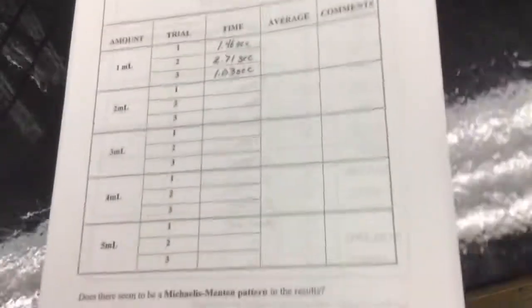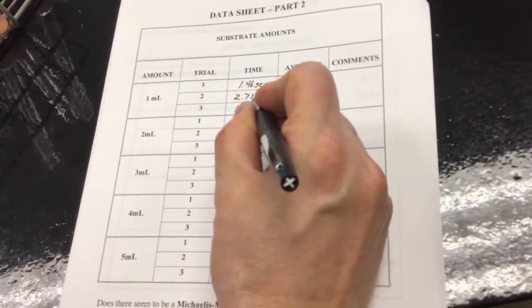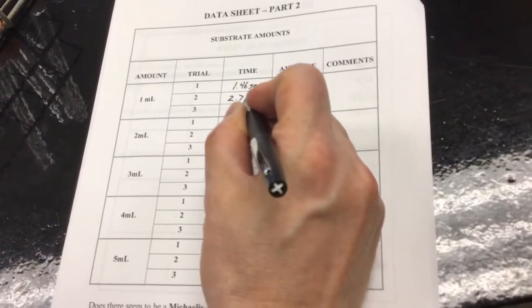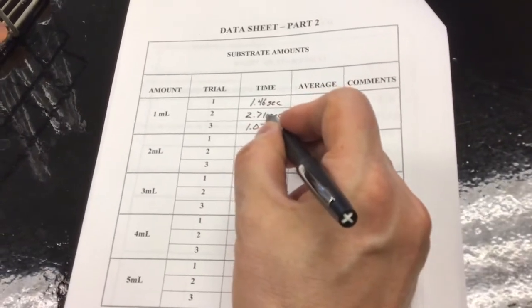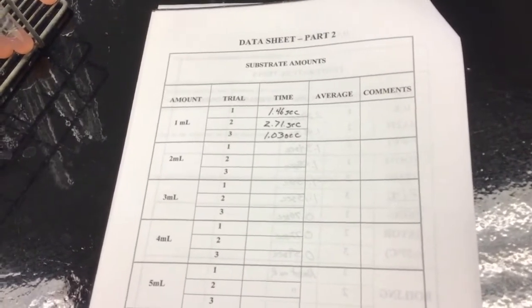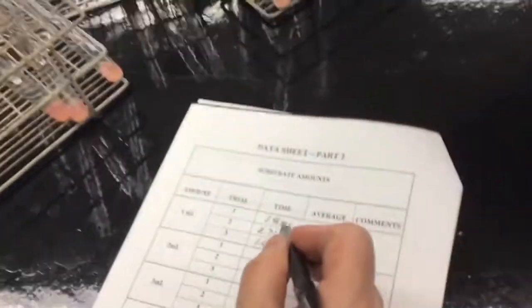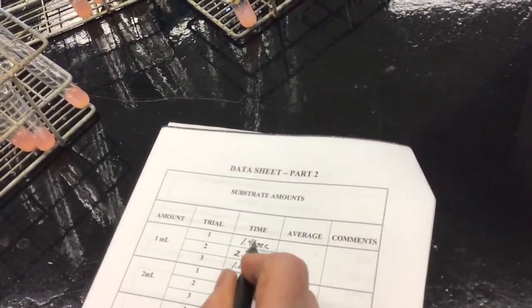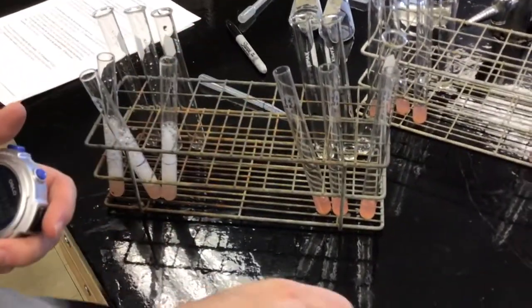Okay, when you're looking to maybe not use something, I'm looking at this and thinking, I may not have zeroed my watch when I took that. So I would subtract 1.46 from that to get the actual number. I'm just playing the beeps back through my head, and I don't think I beeped it. I have to zero this to use it, and I don't think I did between there and there. So that's actually that time plus that time. See, I have not yet finished making my mistakes. Okay, now I've definitely got this zeroed out.